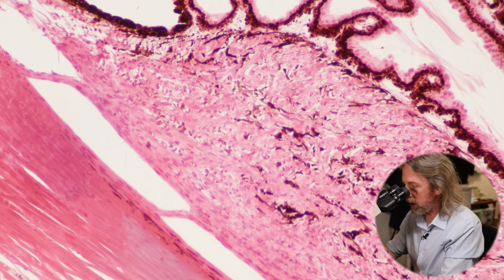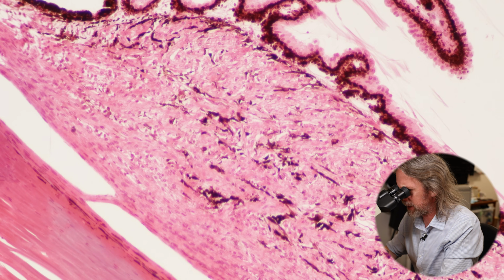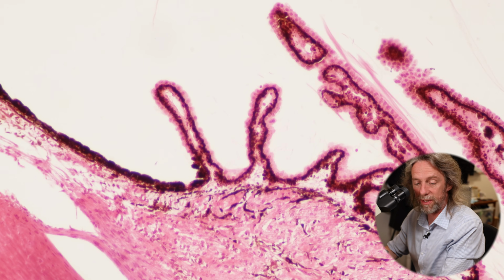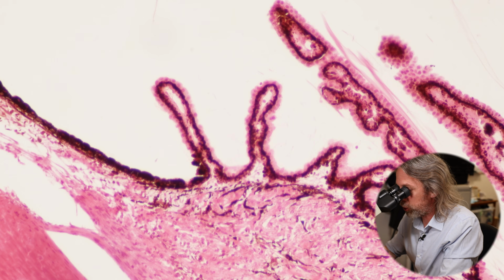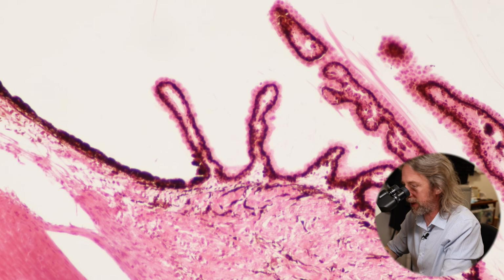Now you can see there's the ciliary body there, smooth muscle and melanocytes and pigment like we find everywhere else in the body. Whereas those ciliary processes are different. I don't know if you can see there, but there are two layers of cells. So we've got one layer of that heavily pigmented epithelium, and then we've got another layer of not at all pigmented epithelium.